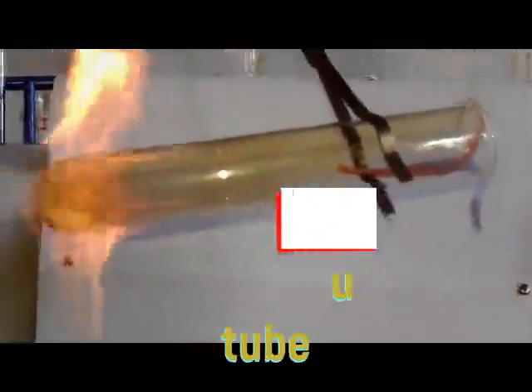You can see that as we are beginning to heat our sample, the one which was white is now turning reddish brown. You can see now it's turning reddish brown. Then as we are heating, we are seeing all our boiling tube inside now turning brown, and you can see there are even some fumes coming out which are brown. So as we are continuing heating, try to follow up the salt at the bottom, which was white, is now turning reddish brown. You can see even the whole boiling tube now.